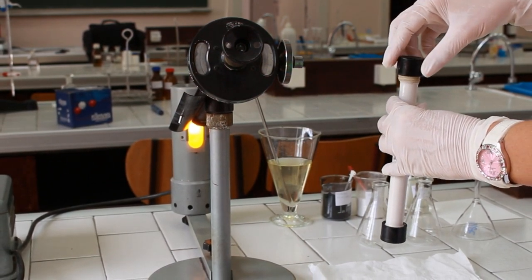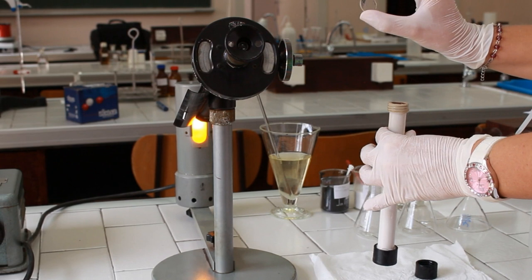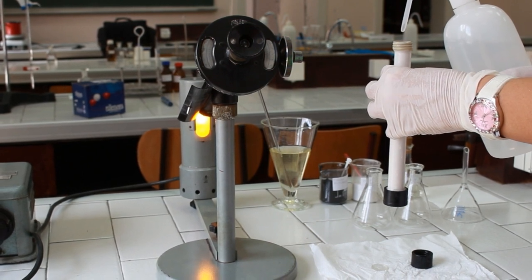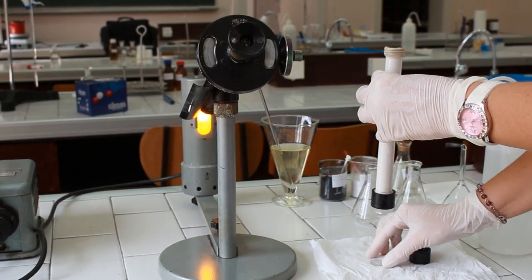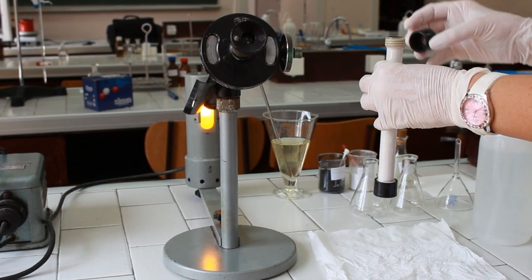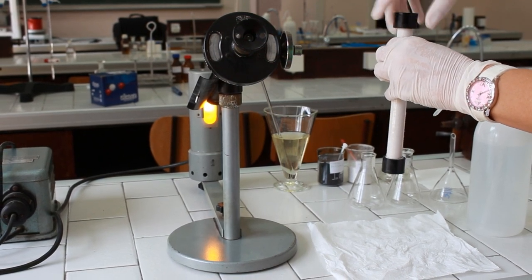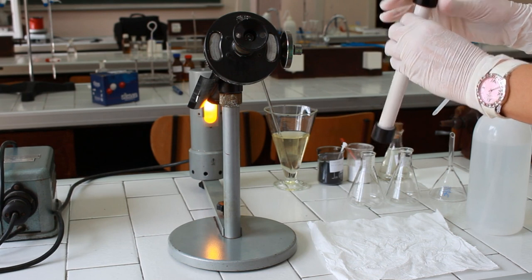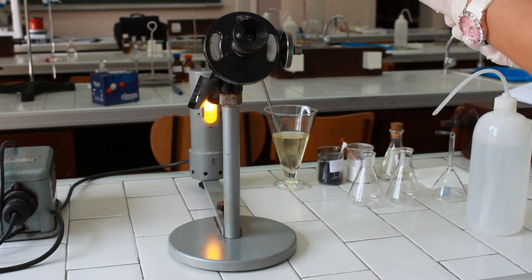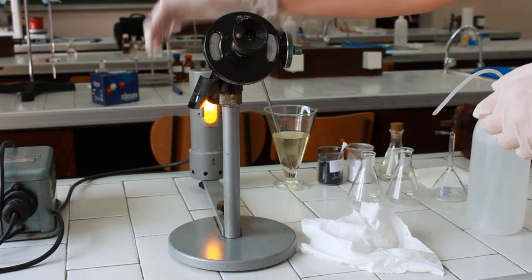In order to do that, first we need to open the polarimetric tube — notice that it has a small glass above it — and pour some distilled water. Return the glass, but do it rather quickly to avoid making any bubbles in the polarimetric tube. Then close it correctly. Check one more time if there are any bubbles in it. Wipe it with a paper towel and place the polarimetric tube into the instrument.